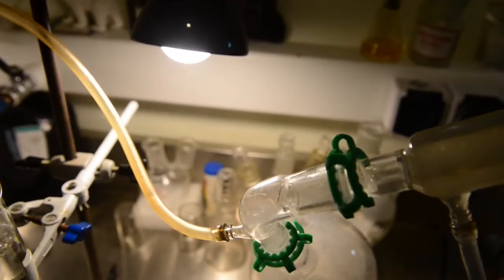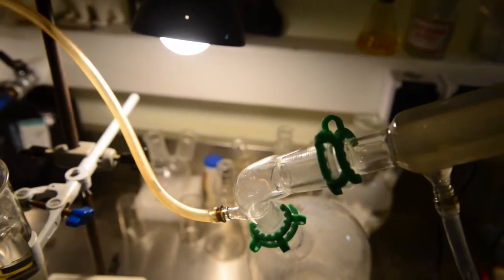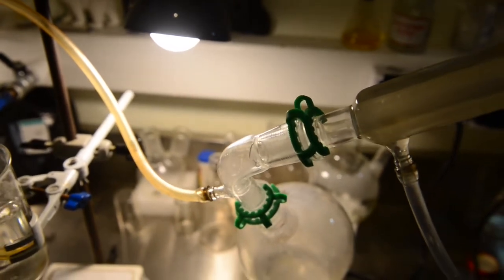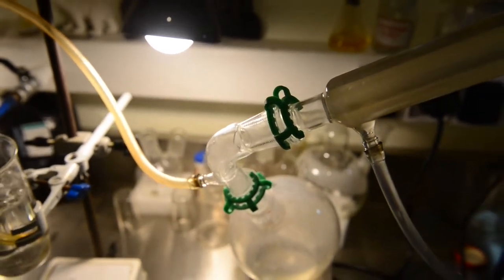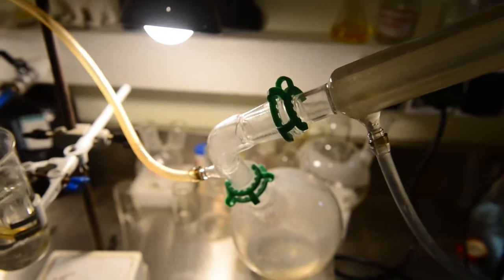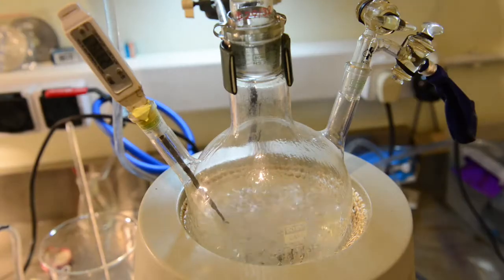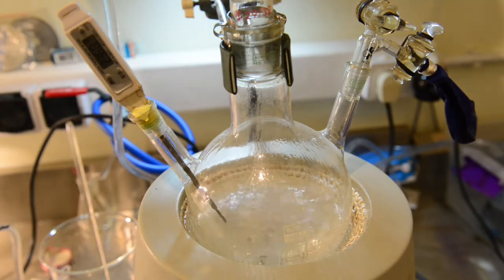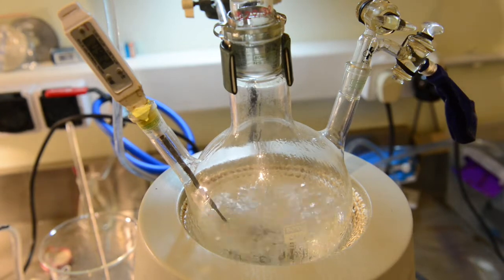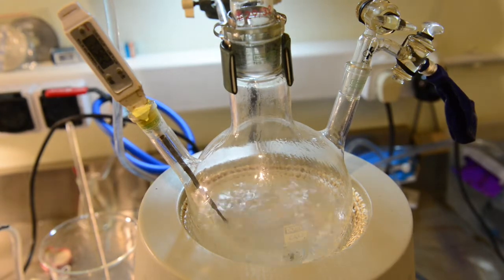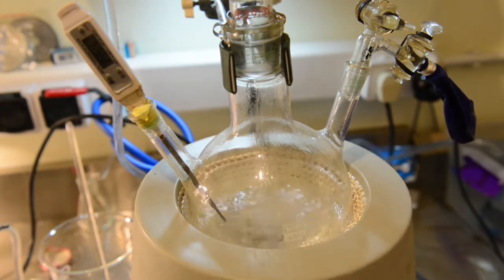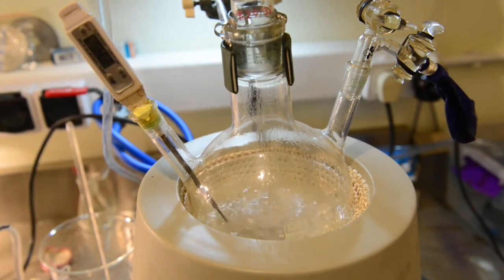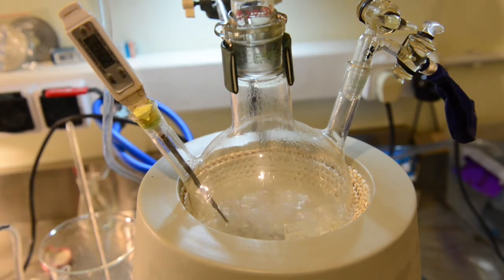We must try to keep the reaction temperature under control. We have been trying to find the best distance to maintain our goal temperature for 25 minutes. The timing I have been following was taken from the Science Madness Forum, the procedure described by Blackstar, but I haven't taken into consideration the fact that I have scaled up the reagents five times. Consequently, the required time to complete the first run of the reaction has increased.